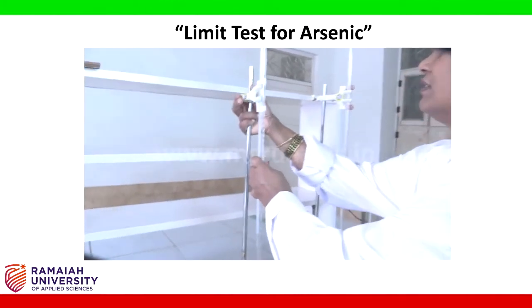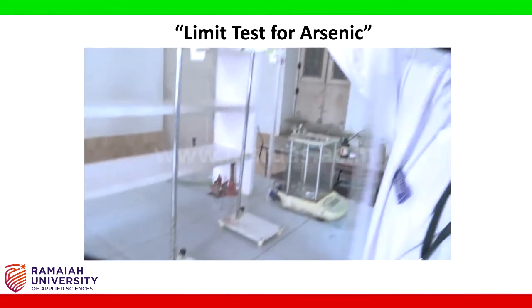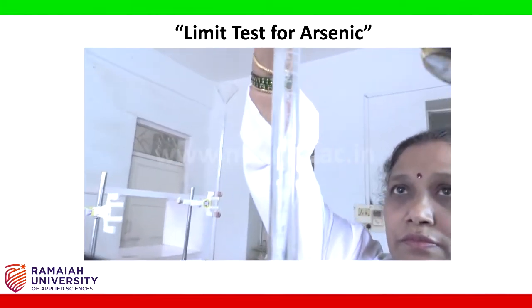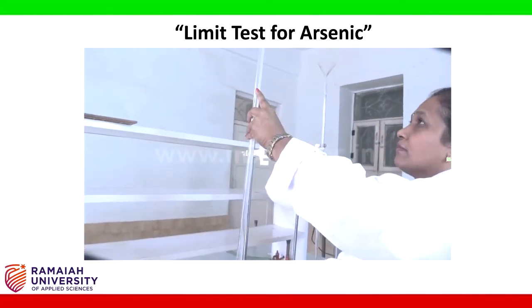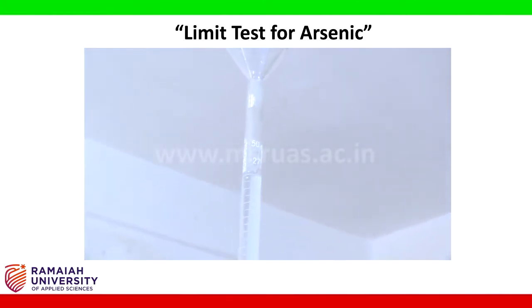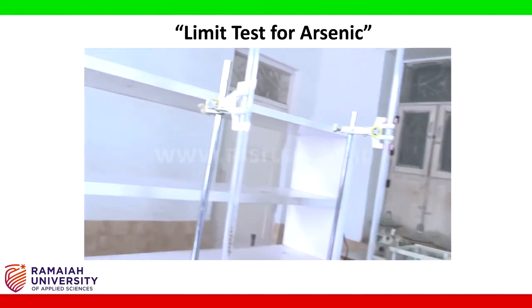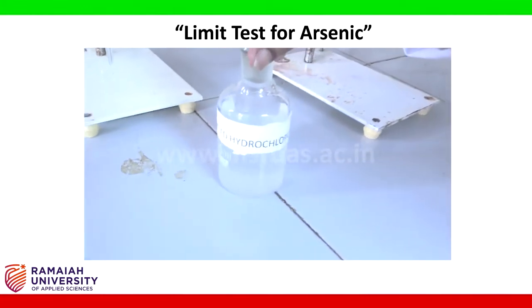First step, we'll fill the burette with standard arsenic solution. Adjust to 0 with lower meniscus. Now in the second burette, we will fill stannated hydrochloric acid.